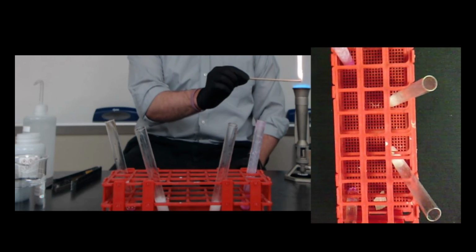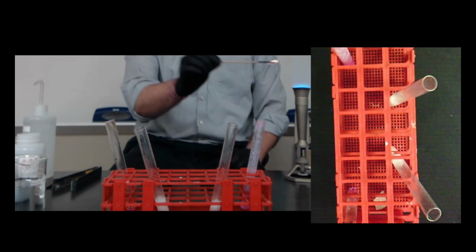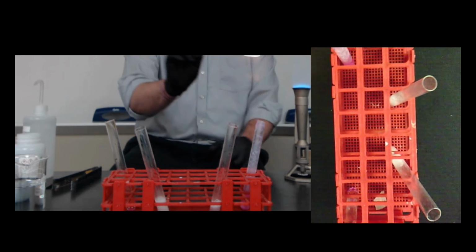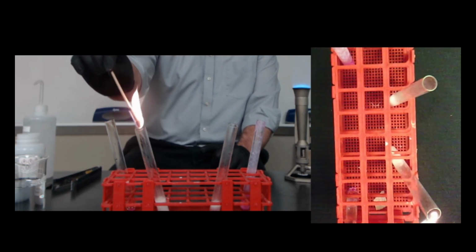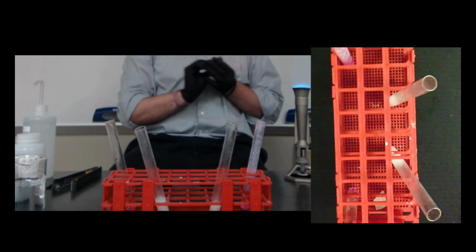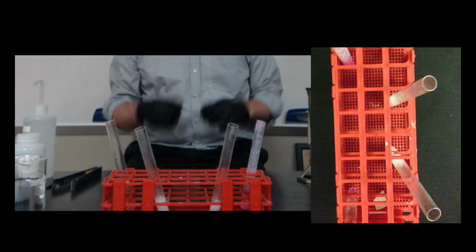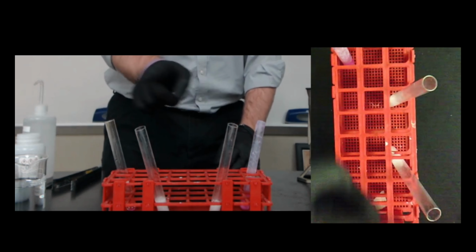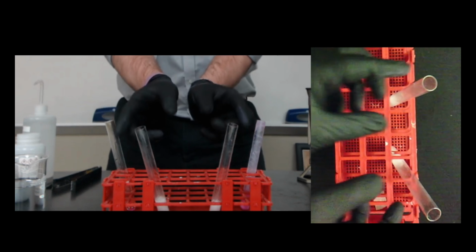So let's see if I can do it again. I'm not always able to get it a second time, but let's see if I can get it again. Let's see if my stick will stay on fire. So this is calcium, and then this is magnesium. Yeah, see, I might not even get it. There it is. Okay. So there's our flame test. So we've confirmed that we are indeed making hydrogen and that the calcium made more than the magnesium did, meaning that the calcium is reacting faster because I'm producing more of the gas.